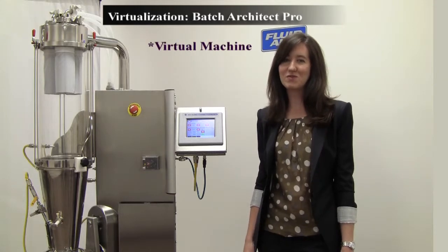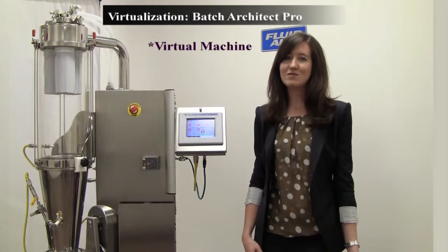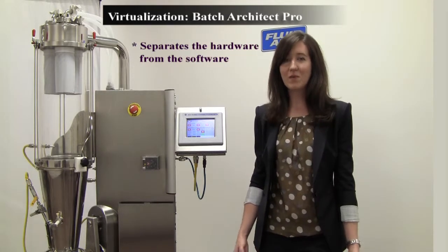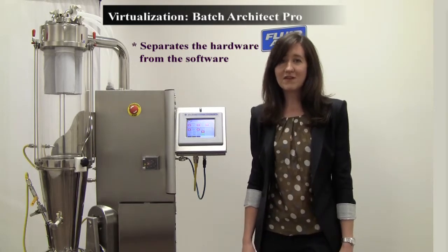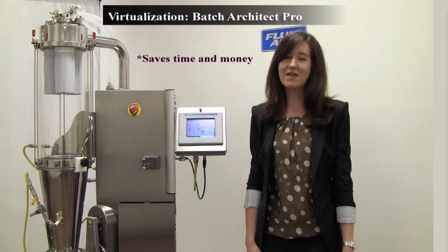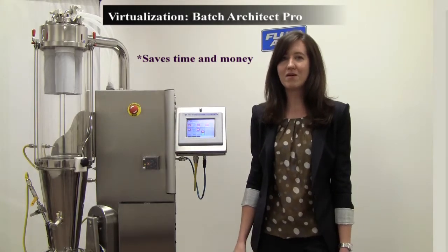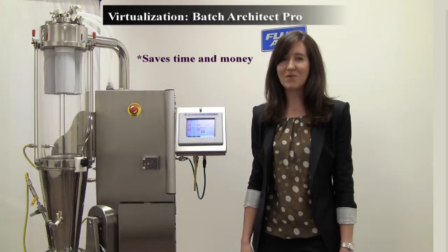One of the new features of our Batch Architect Pro is the utilization of a virtual machine. This allows us to separate the software from the hardware and gain independence from the hardware. In the event of a disaster, that virtual machine can then be copied over to a new computer without worrying about interferences with the new hardware.